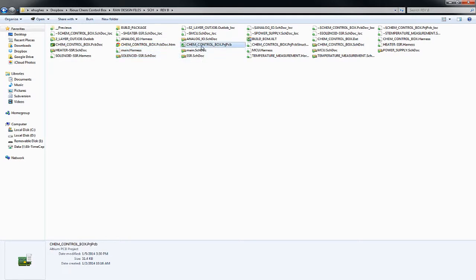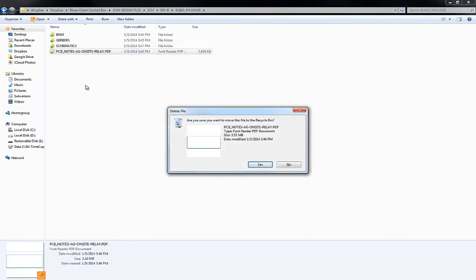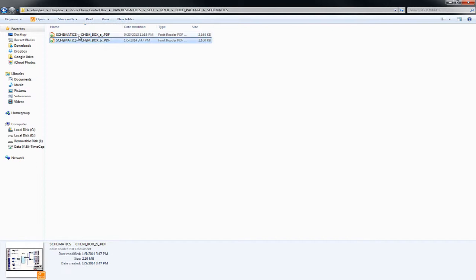Here, for example, is the Chem Control Box project file that, if you have the viewer, you can open. But one thing I want to point out is the build package, which has some files that are built from the raw design files. The one you really want to keep in mind is under schematics, where there is a folder of PDFs for the schematics you can look through.